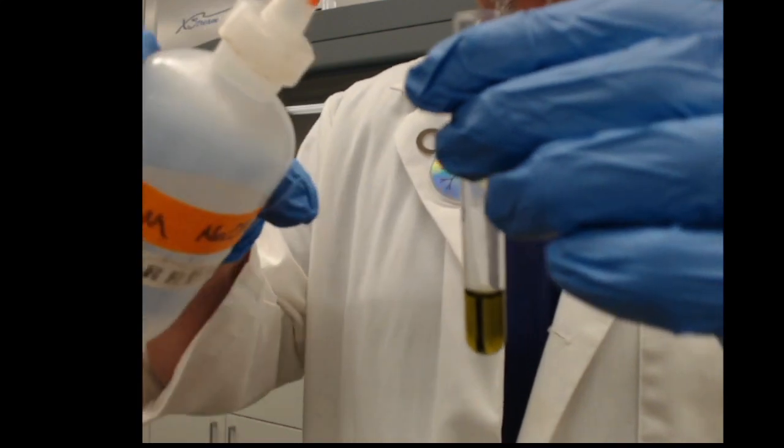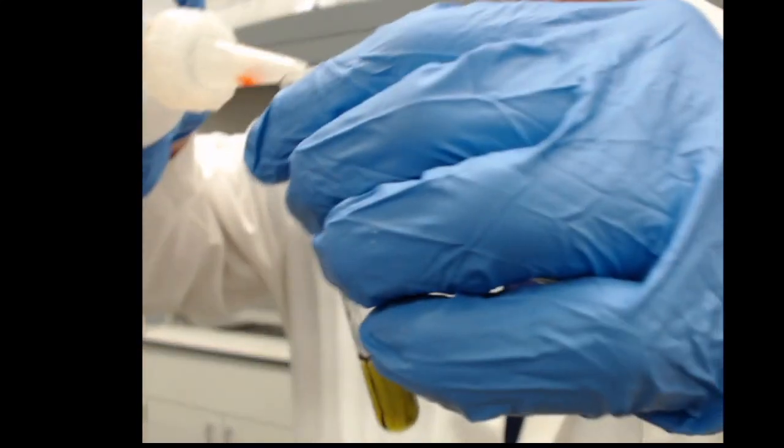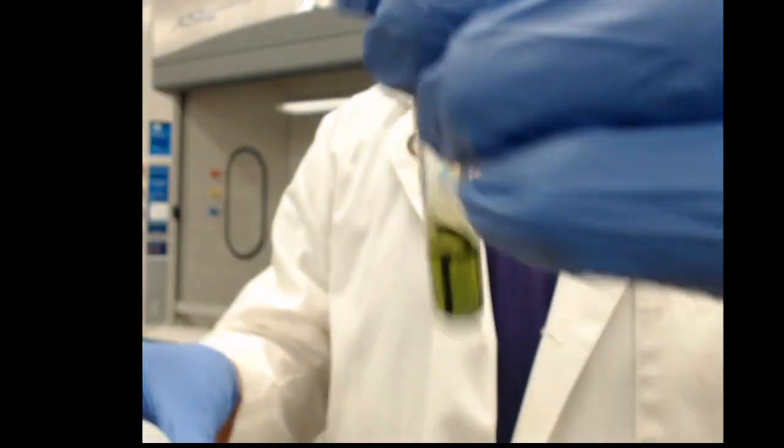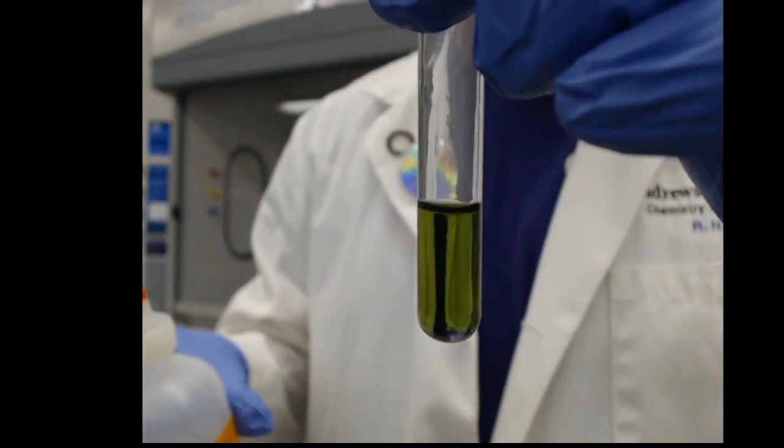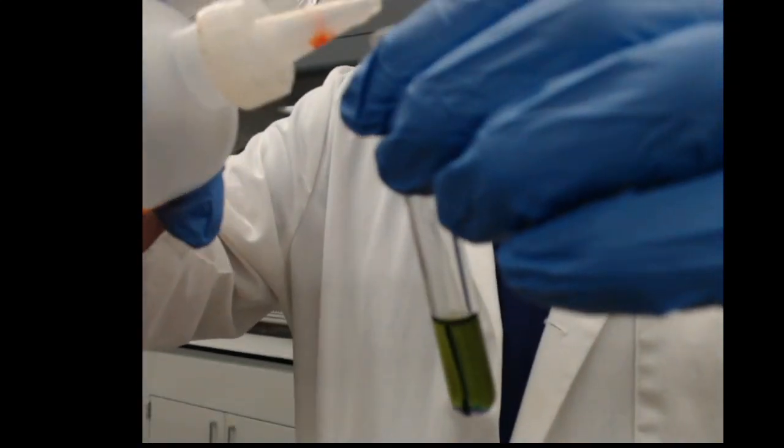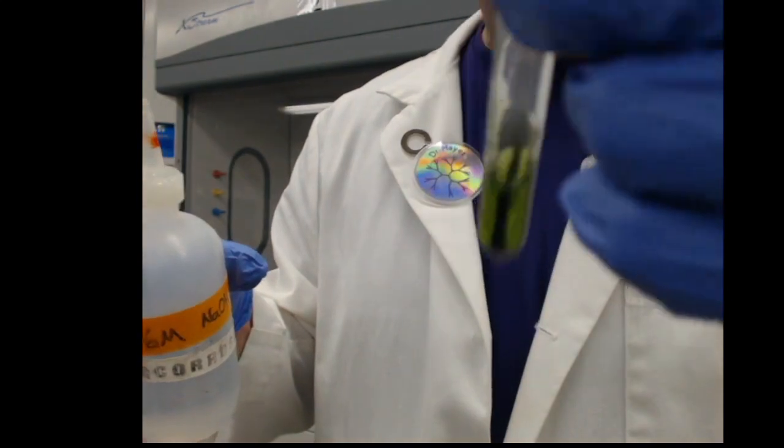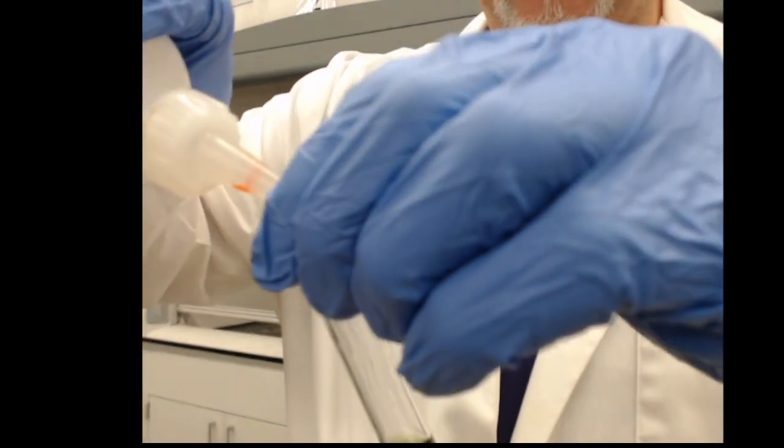This is going to remove hydrogen ions. See what happens. Got to mix it. It's starting to turn green now. More drops. Good green color.